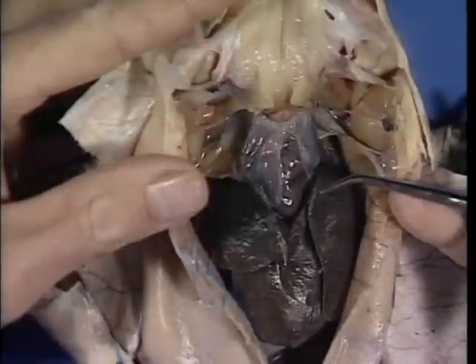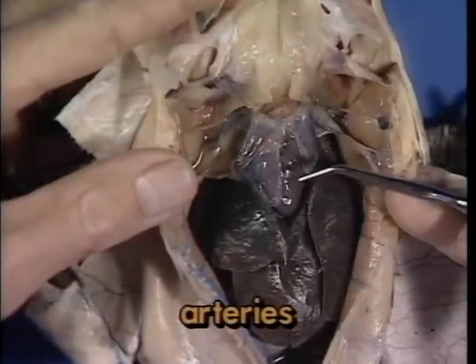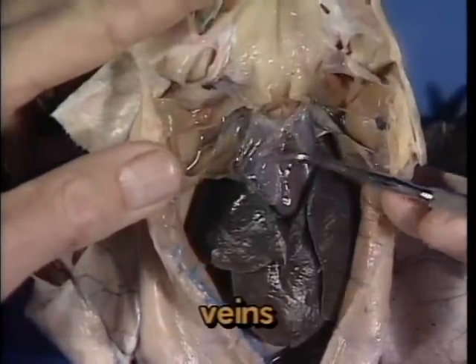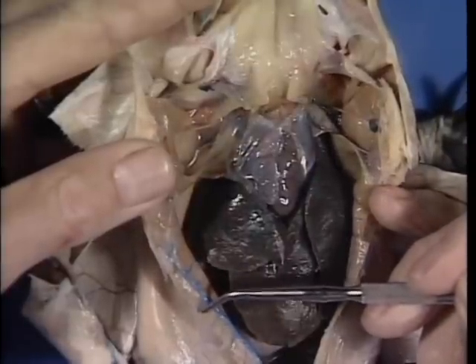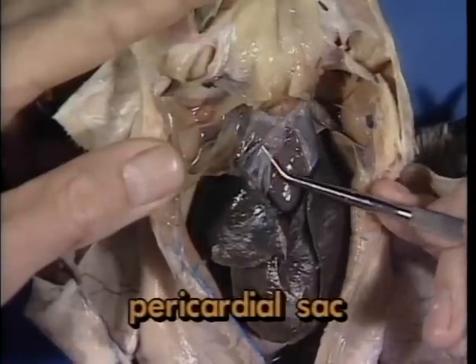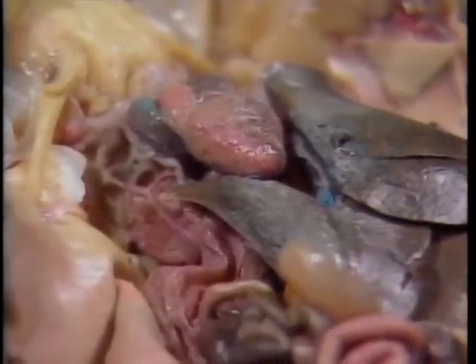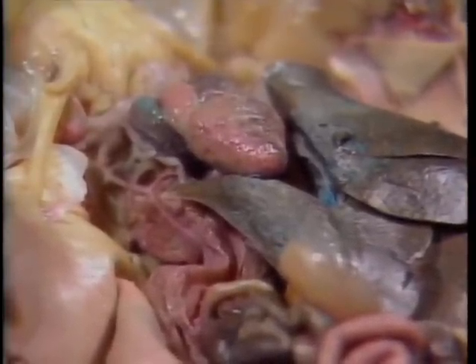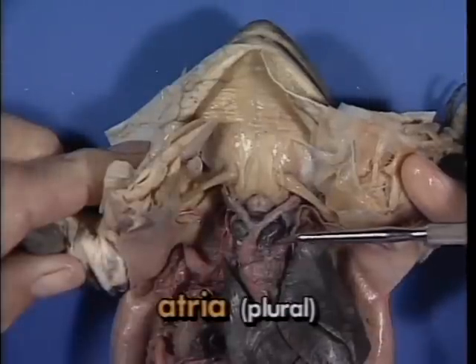You will note as we examine this frog that the arteries have been injected with red latex and the veins with blue latex for easy identification. First, remove the thin, tough pericardial sac which surrounds the heart. The heart of an amphibian is considered to be 3-chambered. Anteriorly are 2 chambers called atria.